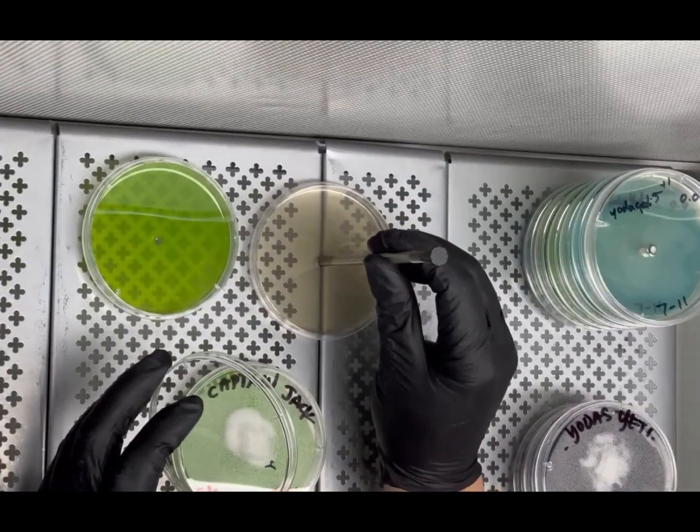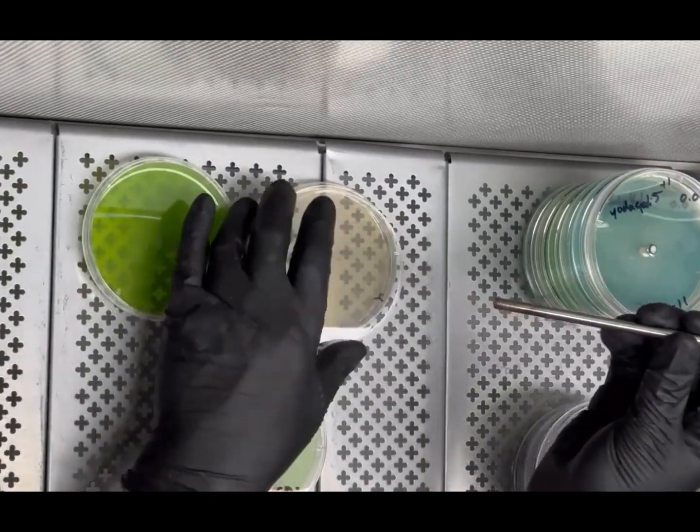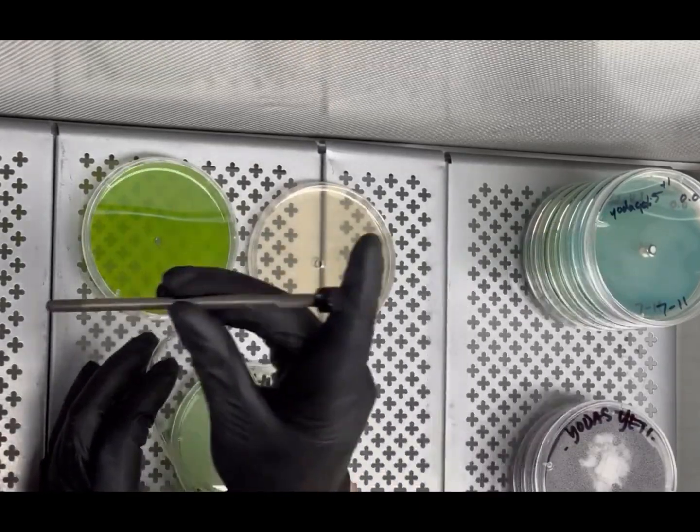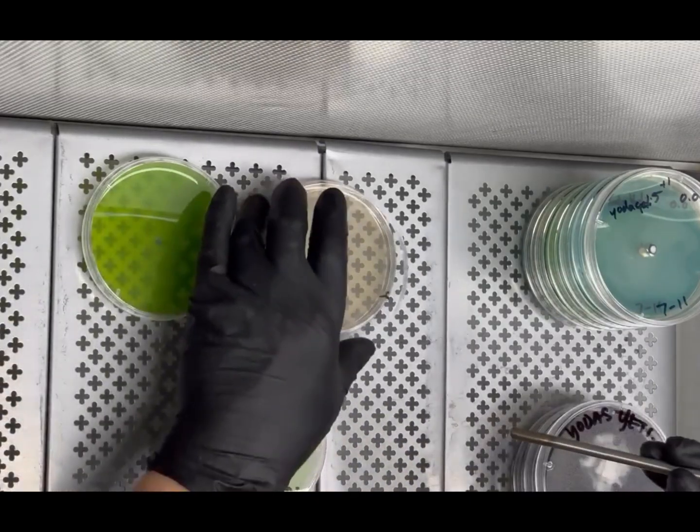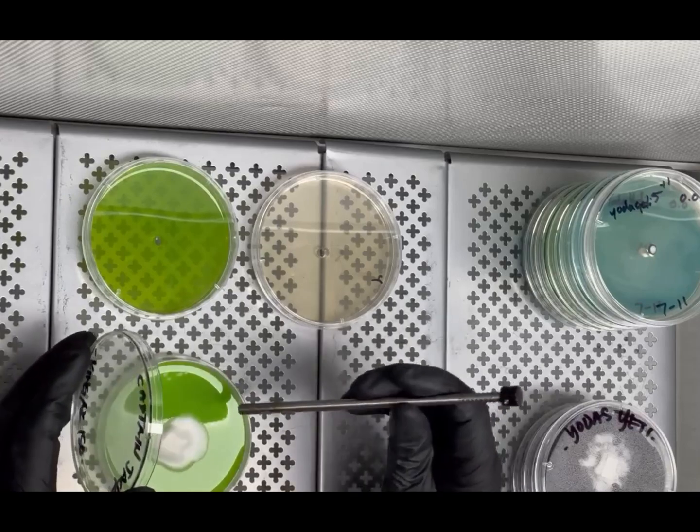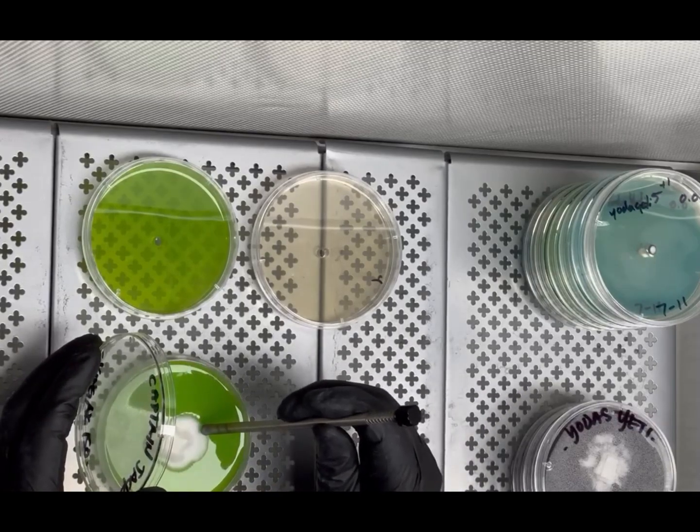I like to do it on both my plates here to make it look nice and even. You've got to do it right, and I didn't do it right that time. But as you can see here, it takes a really good sample from your leading edge there.